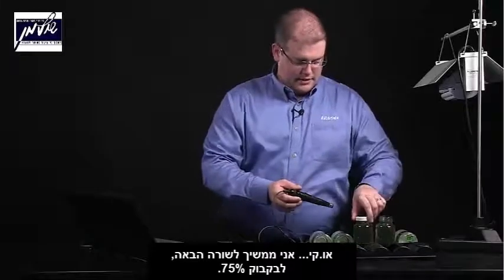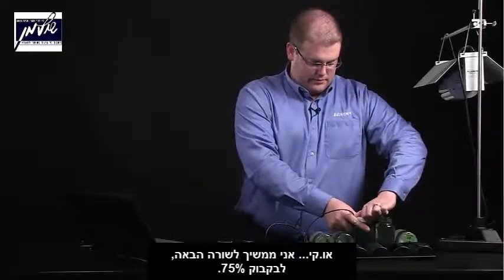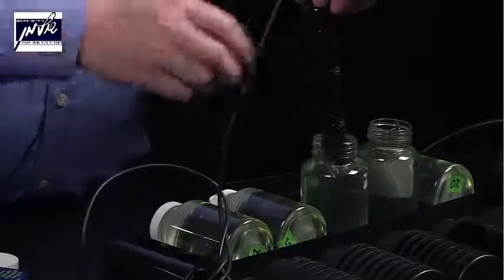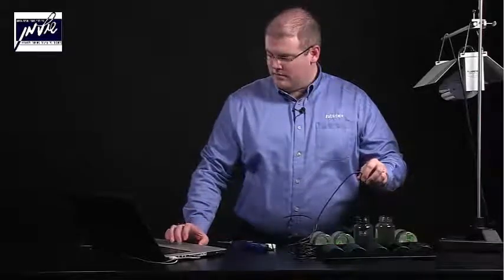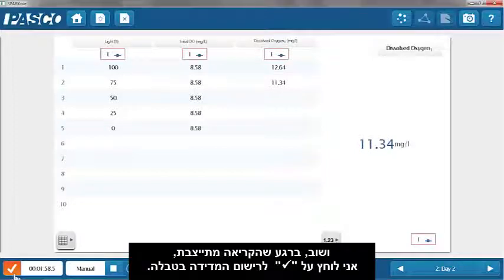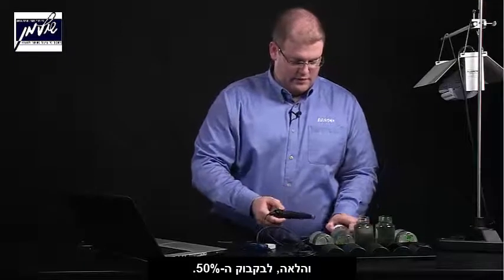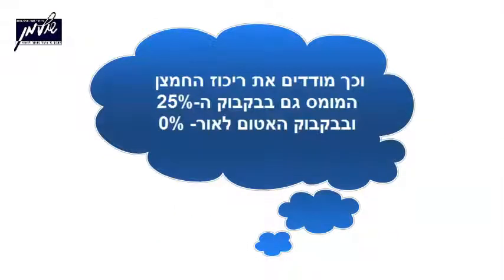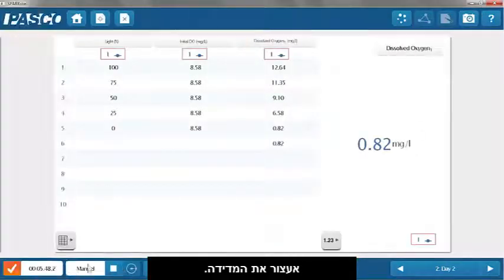I will proceed down the line to the 75% bottle. And again, once we have a stable measurement, I'll press check to proceed. And on to the 50% bottle. So now I'm going to go ahead and hit stop.